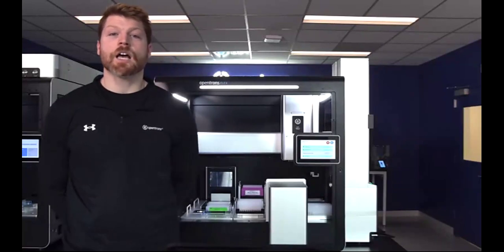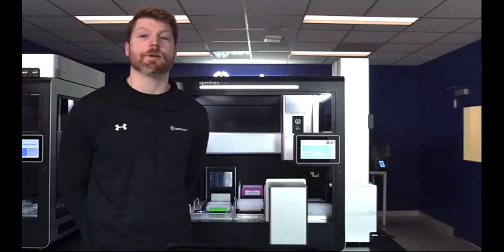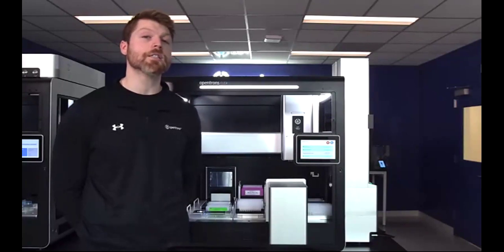Okay, first, just to kick us off, I'll say a couple of things about OpenTrons' ethos and why we exist. It's our mission here to support scientists doing groundbreaking, valuable research with powerful, accessible lab automation that frees you up to do more than just pipette. We've helped thousands of labs all across the world automate an extensive workflow list. The OpenTrons Flex is our newest generation robot, and we're excited to show you how it can help you and your lab increase your throughput and automate your NGS workflows with both existing modules and what we are debuting.